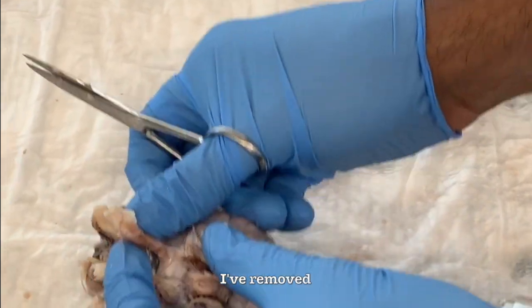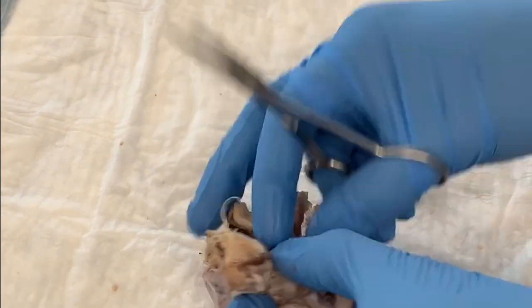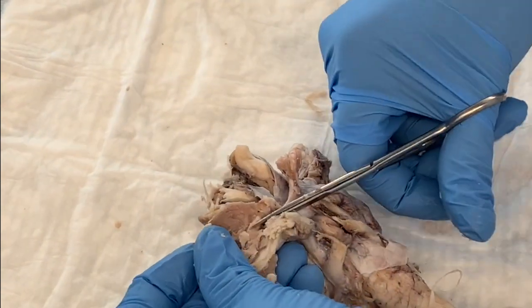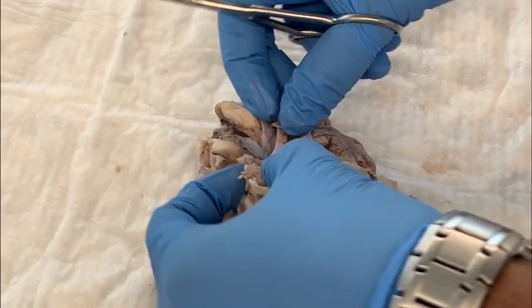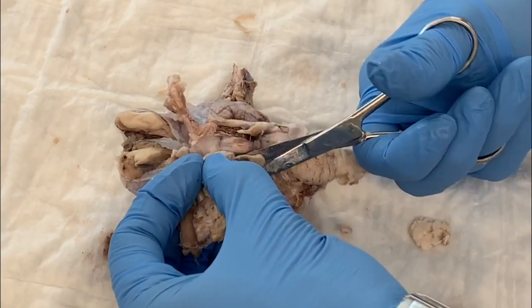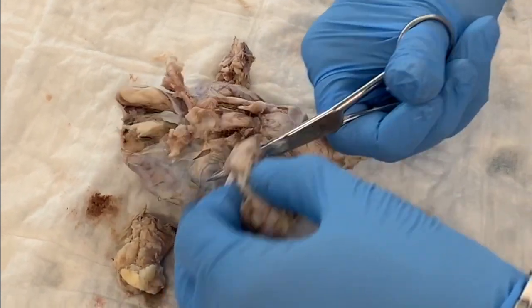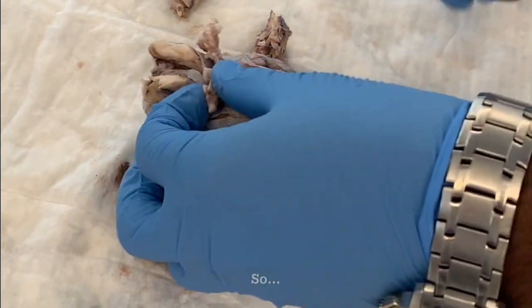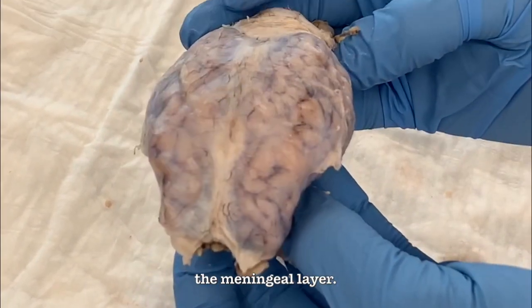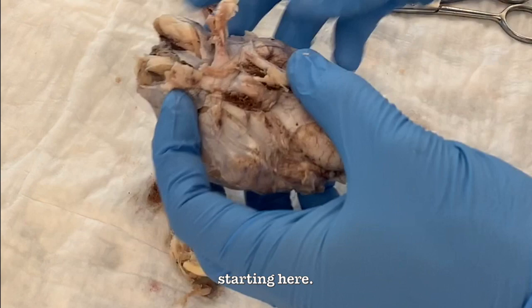And so you see I've removed all the fat surrounding this optic nerve. I'm going to do the same for the other side as well. Right, so we see the two optic nerves, and notice I'm cutting off the remaining periorbital fat. So here we have the two optic nerves. Now what you see here is the meningeal layer, and we're going to remove it by cutting starting here.